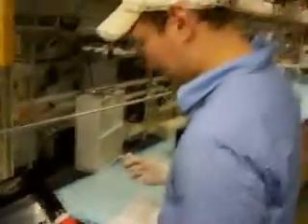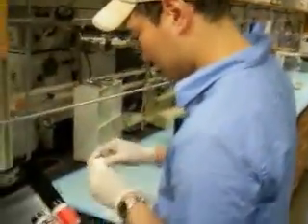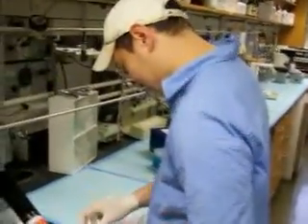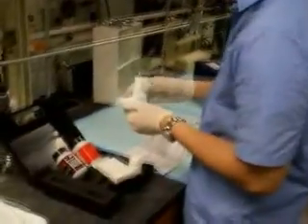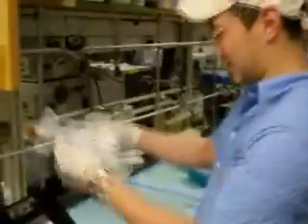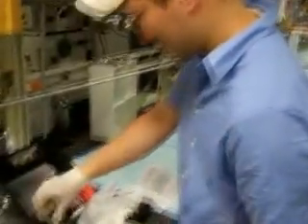Okay. Let's go with the pipette first. I will assume, what is this white thing for? White collecting box. It's a white collecting box. That's what it says in the instructions. I wonder how much the spill kit costs. Not exactly. Here are disposable gloves. Let me don the appropriate. Oh, disposable gloves.